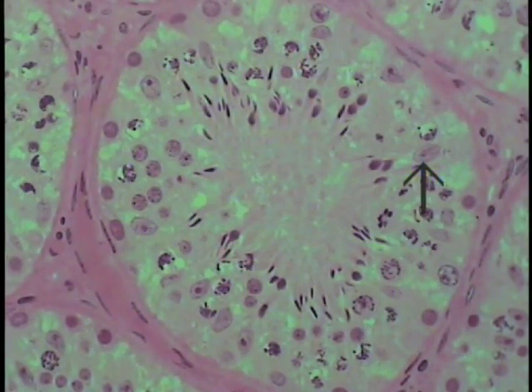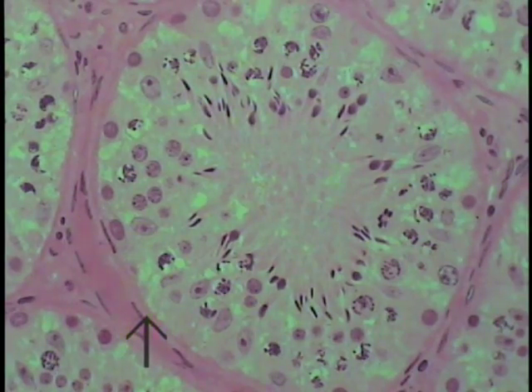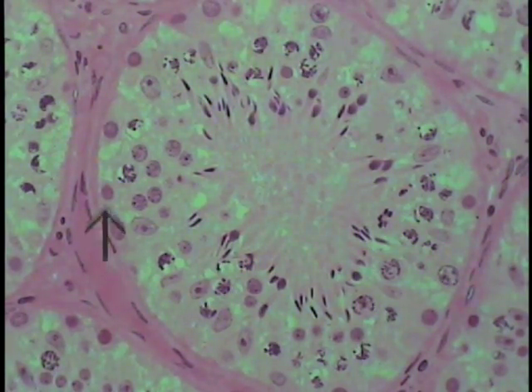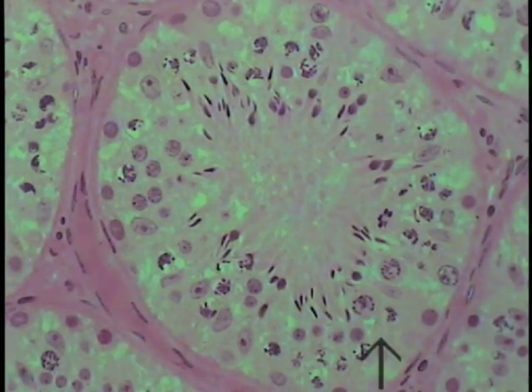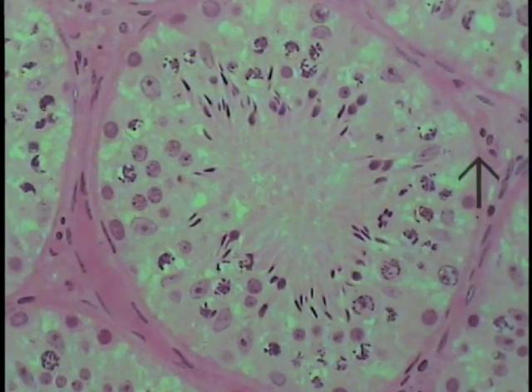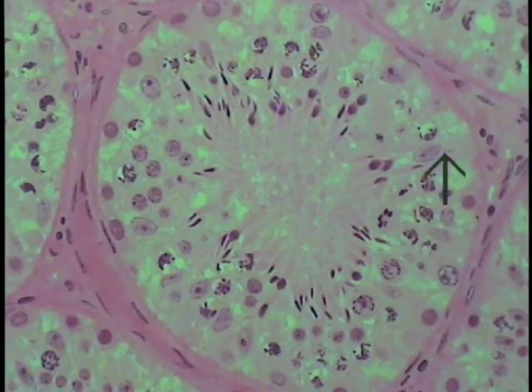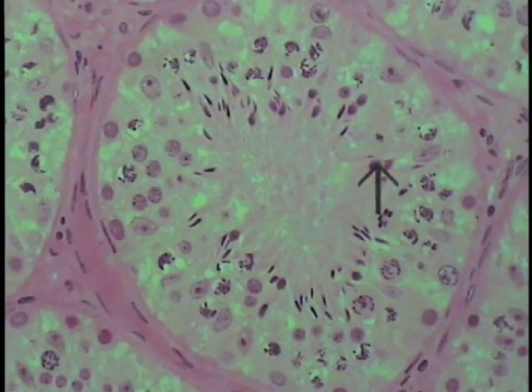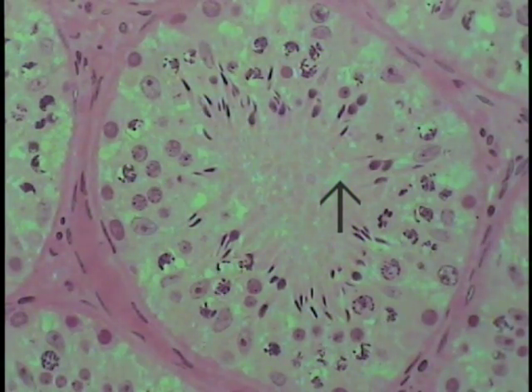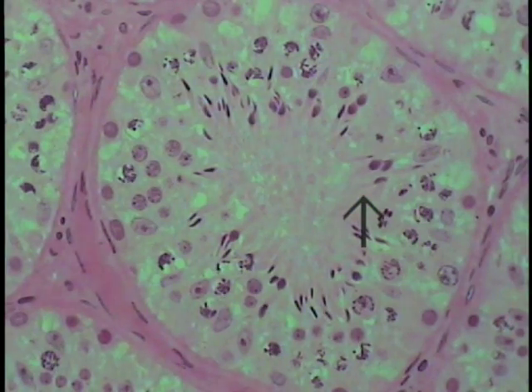Looking at this particular Sertoli cell, one can visualize the cytoplasmic base where it lies upon a basal lamina adjacent to the paratubular connective tissue surrounding the seminiferous tubule. Those flattened cells — the so-called myoid cells — make up this paratubular or boundary type of connective tissue. The Sertoli cell's base lies on the basement membrane, and the cell extends from the basal lamina all the way to form the lining of the seminiferous tubule — its cytoplasmic apex reaches up to this region.